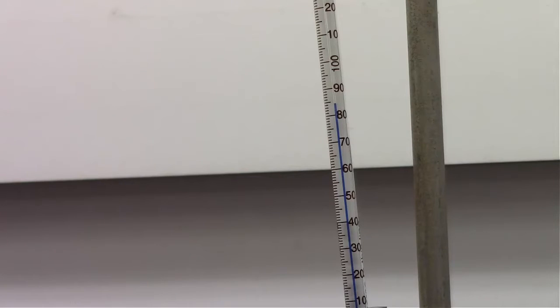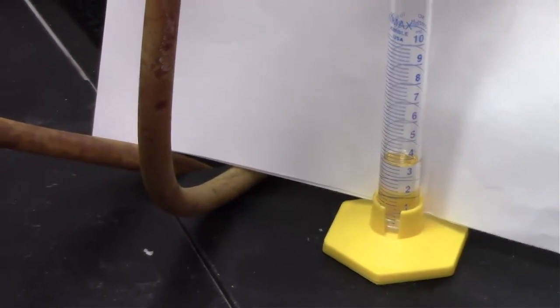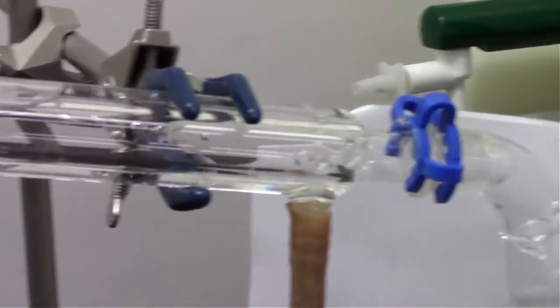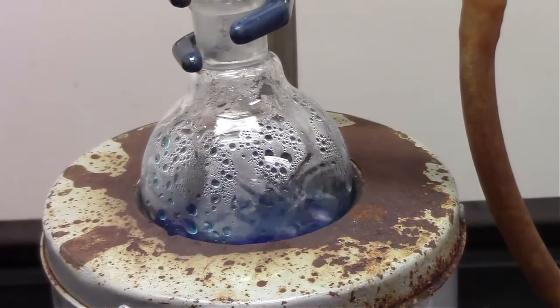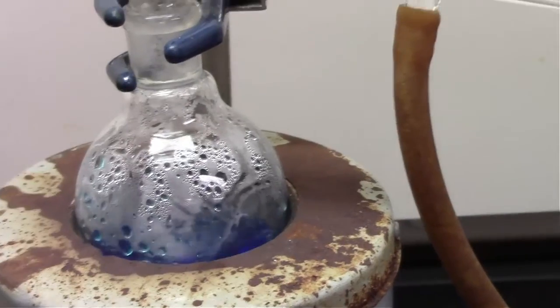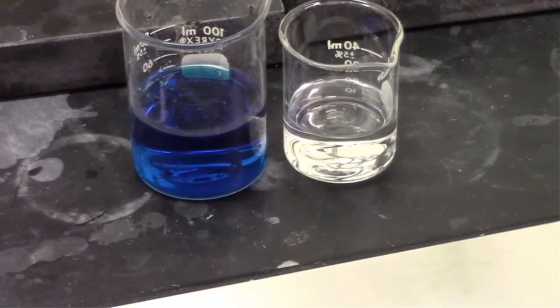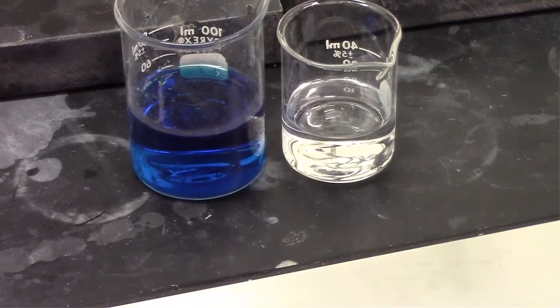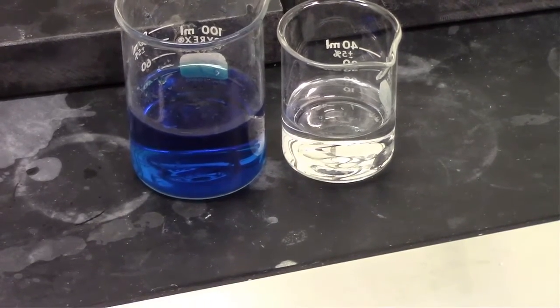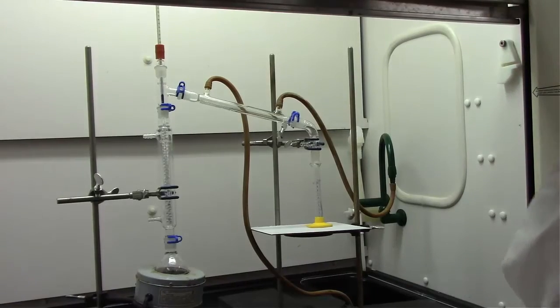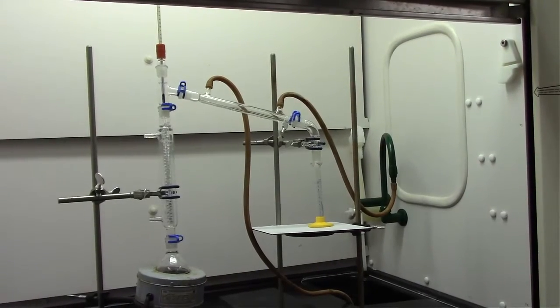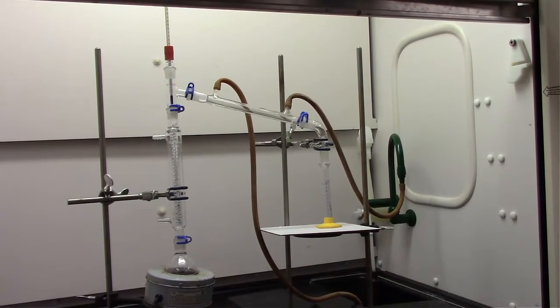So, right now we're keeping our eye on the thermometer, and I clipped out some of the video just to show that there's no reason to watch it slowly climb, but we're not collecting any liquid right now. The temperature is steadily increasing because those evaporation condensation cycles of water are getting up near the head of the thermometer at this point, which means that there really is no more acetone to be collected. So right now we're at 23 milliliters, of that 23 milliliters, I would say about 20 of that was pure acetone. And at this point we stopped collecting, we're at 23 milliliters, and that is the solution that was left. So, we had about 23 milliliters of mostly acetone, some water, and then all the rest of that, about 27 milliliters, was water, which still had that dye in it.